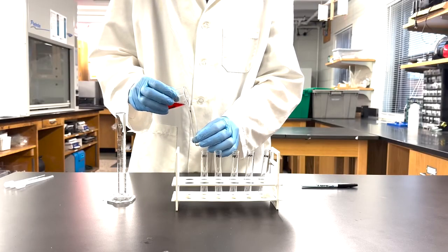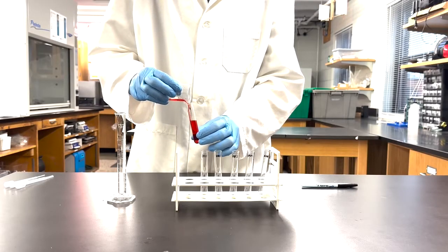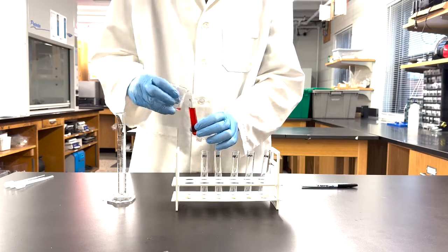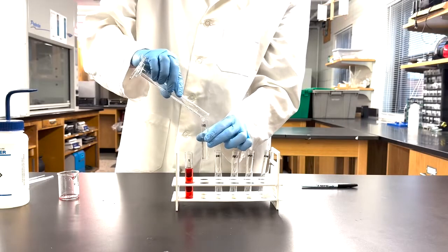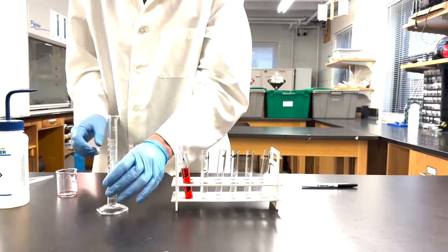So that we end with the same final volume in all of our tubes, begin with 10 mL of our stock solution. In each dilution tube, add 9 mL of diluent. We arrive at this volume by subtracting the initial volume from the final volume.